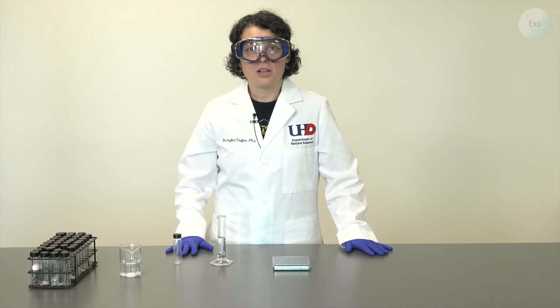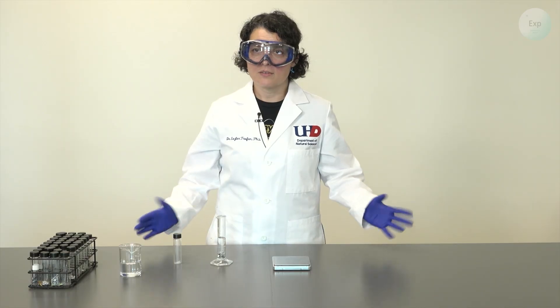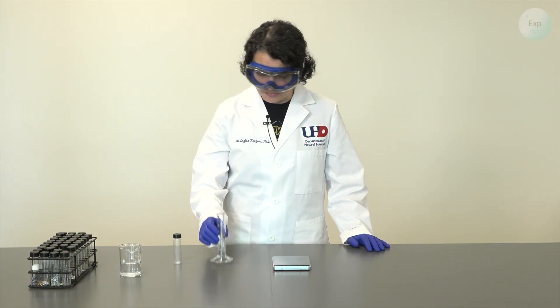We have our volume before and after. The difference will give us the volume of our objects.